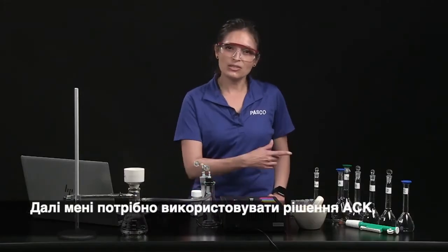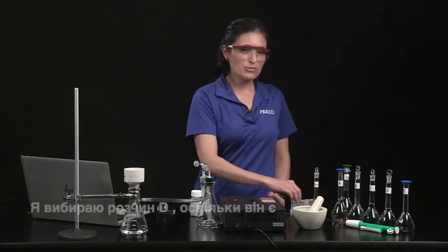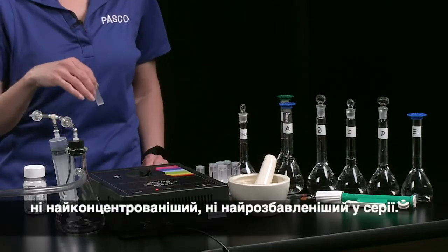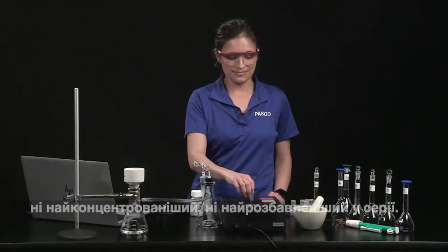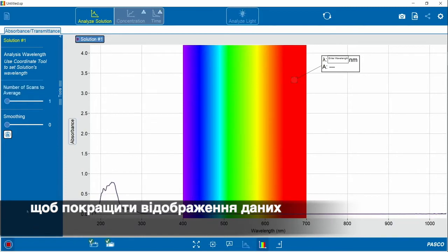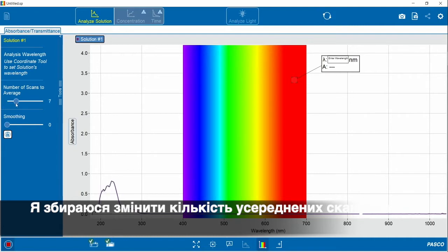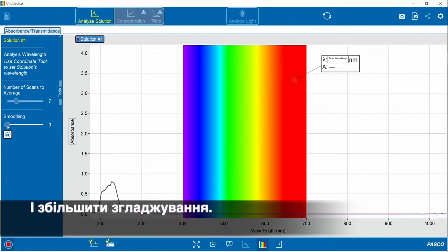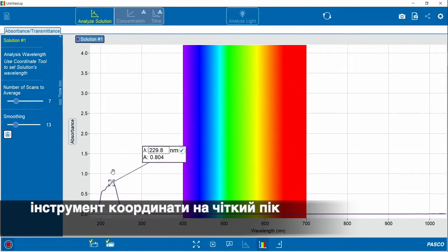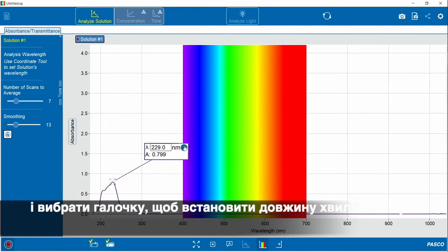Next, I need to use an ASA solution to choose an appropriate analysis wavelength. I am choosing solution D since it is neither the most concentrated nor the most dilute in the series. Start recording data and make the adjustments necessary to improve the data display. I'm going to change the number of average scans and increase smoothing. And then I'm going to move the coordinate tool to a distinct peak and select the check mark to set the analysis wavelength.